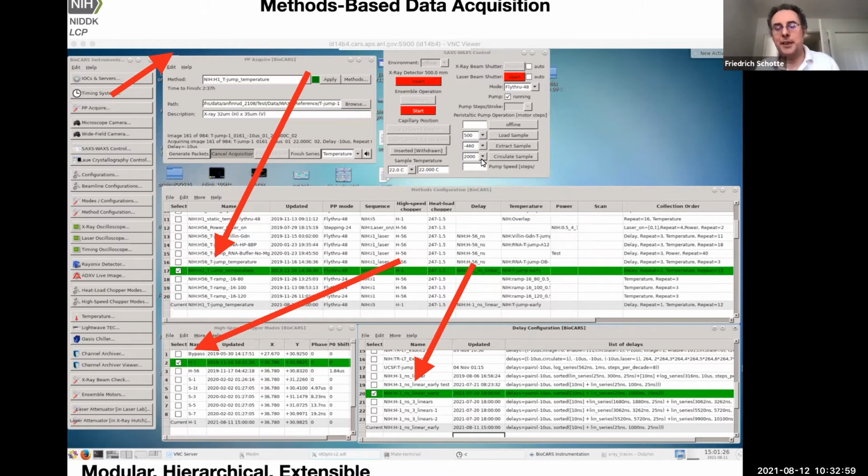Of course, there are some other aspects. For example, these are liquid samples. You need to load them, so you need to operate this capillary you saw scanning. You just set it up, align it properly, put it in the beam, load the sample, or flush the capillary, empty the capillary, replace the sample. So all these aspects of the sample handling of this particular sample are in this control panel. So that's just for the preparation of the data collection.